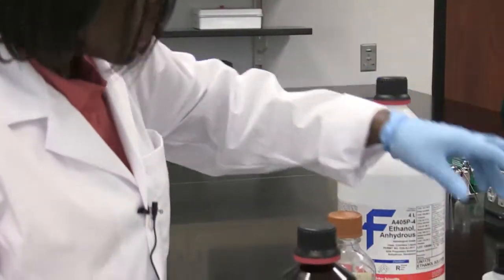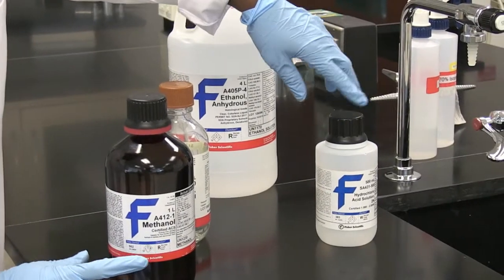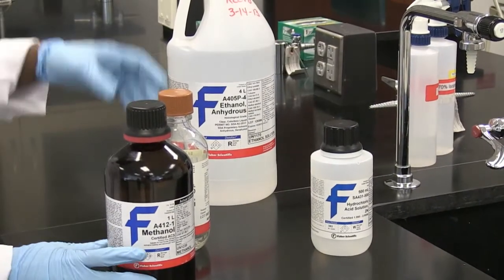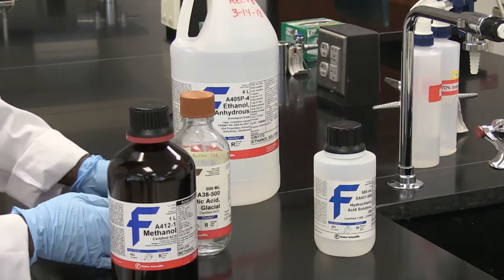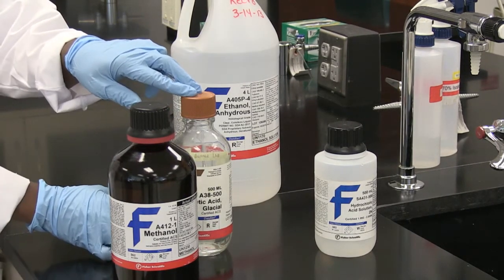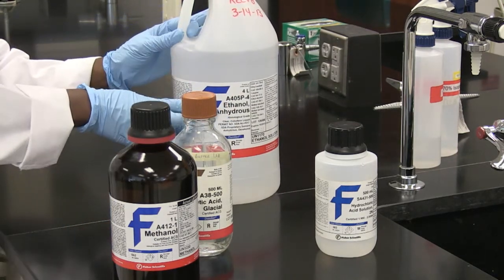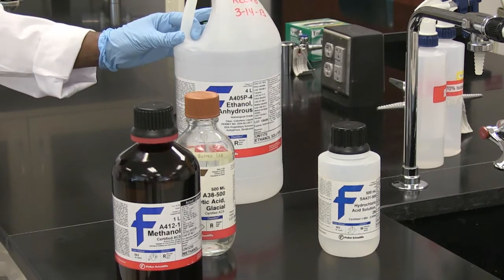I'm going to talk about some rules you need to follow when working with chemicals you may come across during the semester. Here we have methanol, a type of alcohol; a two normal solution of hydrochloric acid; glacial acetic acid, which is similar to the acid found in vinegar; and 100% ethanol, also called anhydrous ethanol.